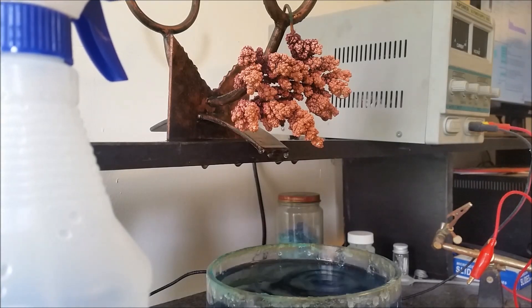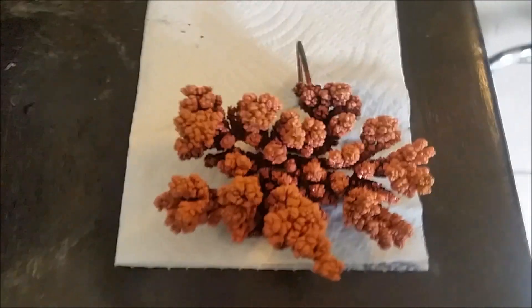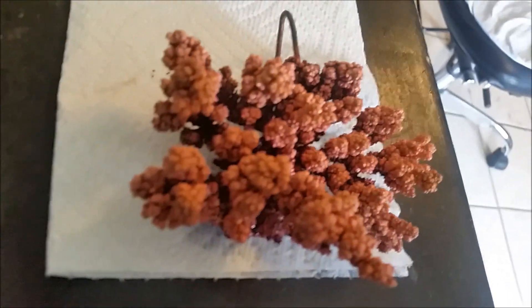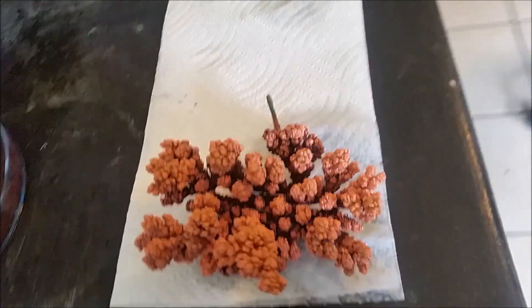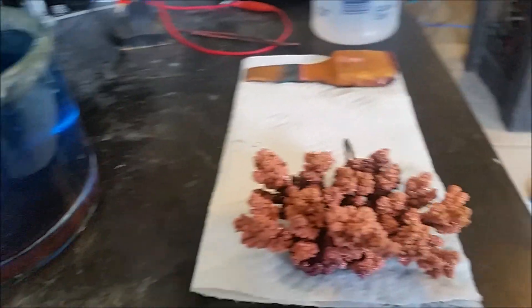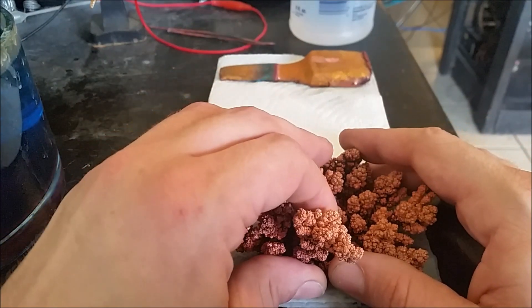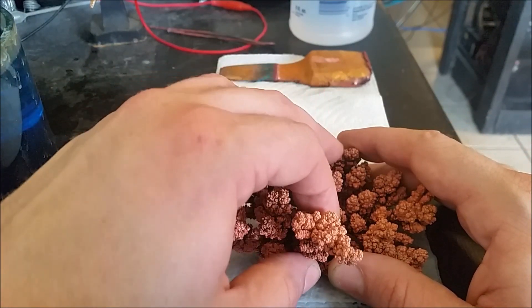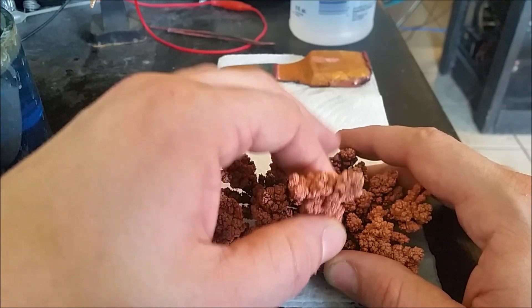I'm going to let this drip, spray it again, and pick the camera back up once I'm ready to pull the crystals off. I have these rinsed off and for the most part dry. Now it's time to pull them off. The main thing to watch out for is not breaking them in the middle — you want to break them towards the base. I'll start with the biggest one here.